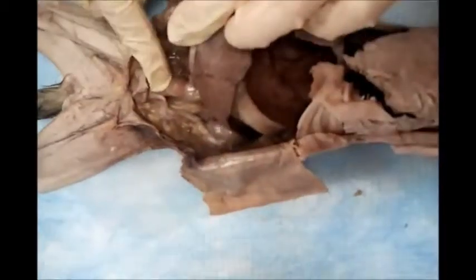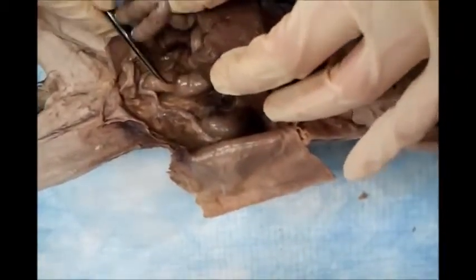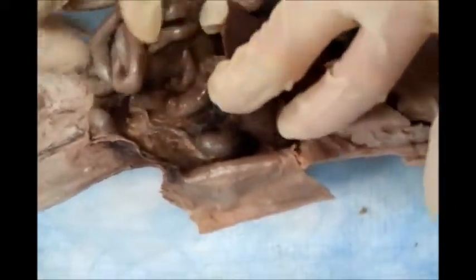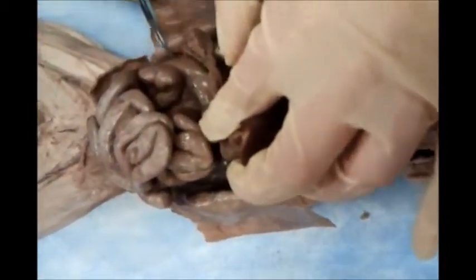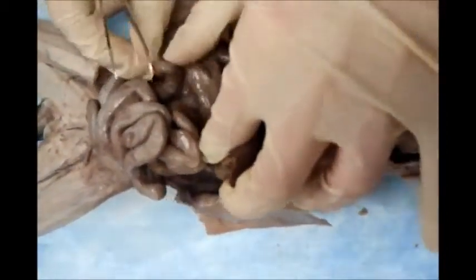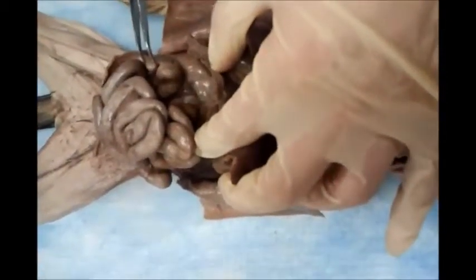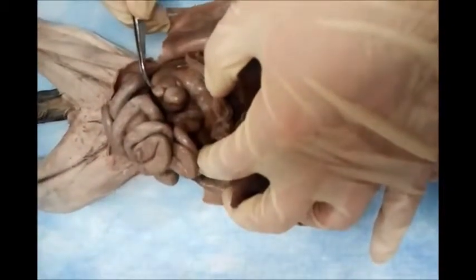So we go from the bottom line, from the anus, and then follow up to the rectum, descending colon, yes, transverse colon, a very short segment, the transverse, and then ascending colon, and then you switch to the intestine, whatever place, like that, and here you go, the end. Where is the end of the small intestine and the start of the large intestine? So the first piece of this large intestine is the cecum. Where is the cecum? Yes.